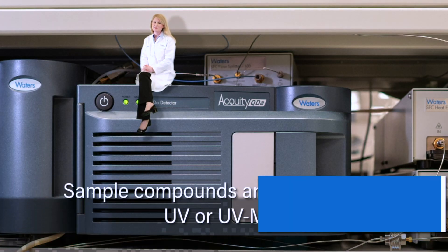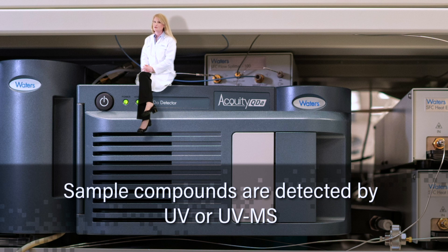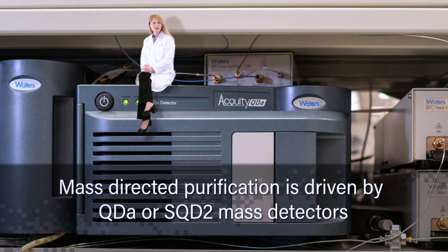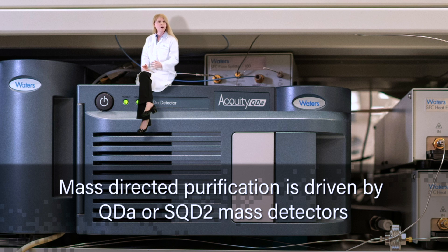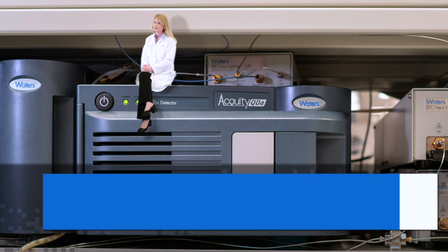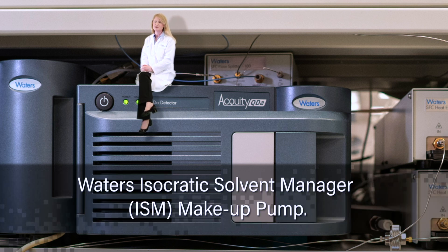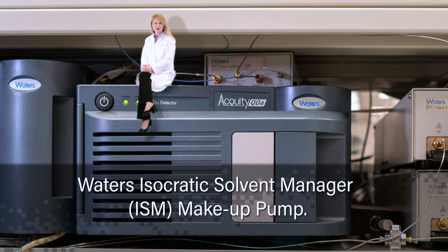Sample compounds are detected by UV or UV-MS. Mass-directed purification is driven by QDA or SQD2 mass detectors, which now feature the Waters Isocratic Solvent Manager ISM makeup pump.